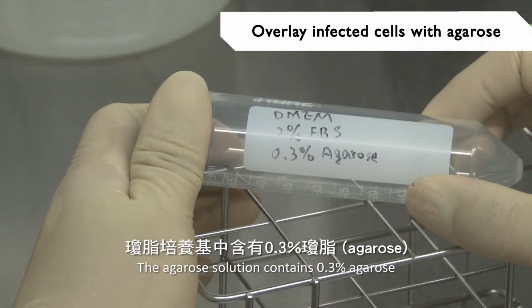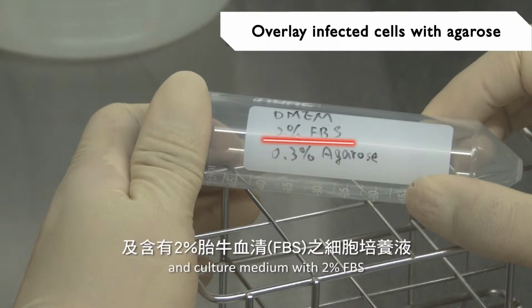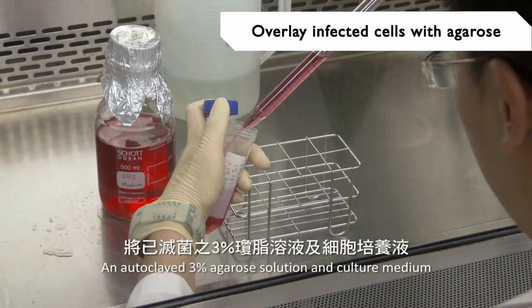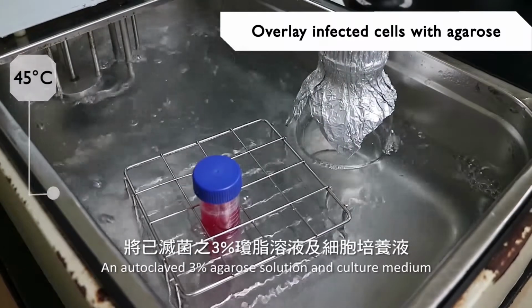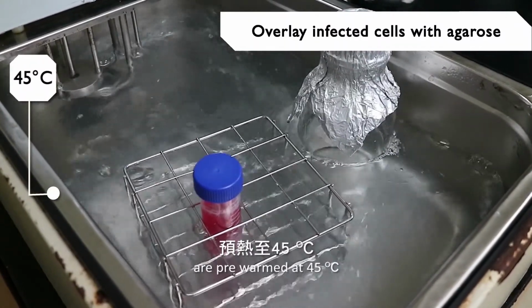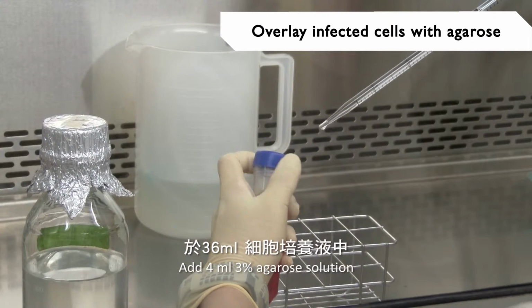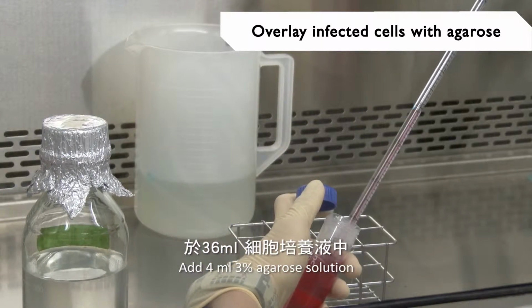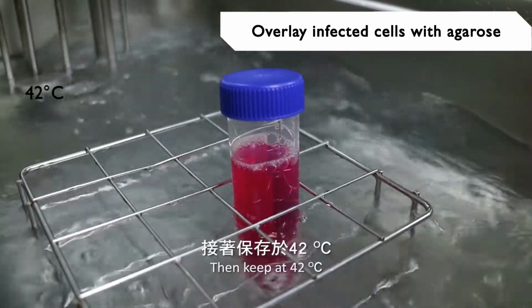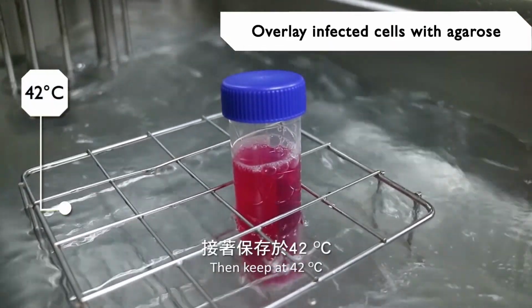The agarose solution contains 0.3% agarose and culture medium with 2% FBS. An autoclaved 3% agarose solution and culture medium are pre-warmed at 45 degrees Celsius. Add 4 ml 3% agarose solution into 36 ml culture medium. Mix well, then keep at 42 degrees Celsius.